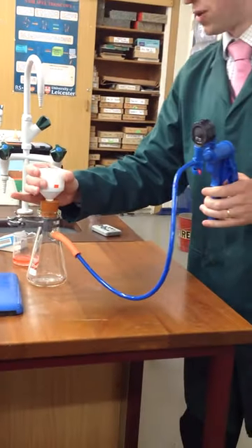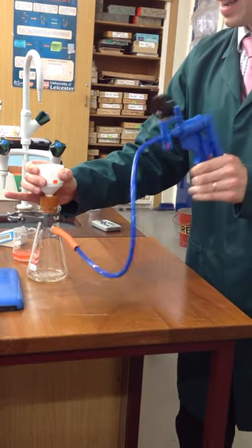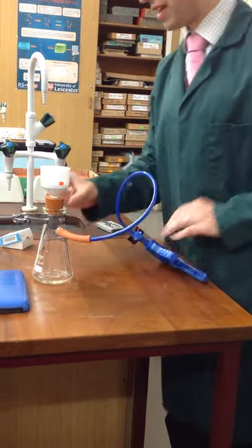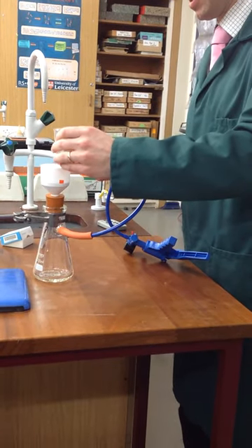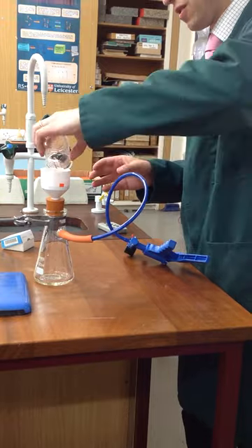Now if you just push down on this to make sure there's good seal and suck, you can see that immediately stuff comes through. So if you put the solution on top, just give it a swirl so that all the solid comes up from the bottom, pour it in.